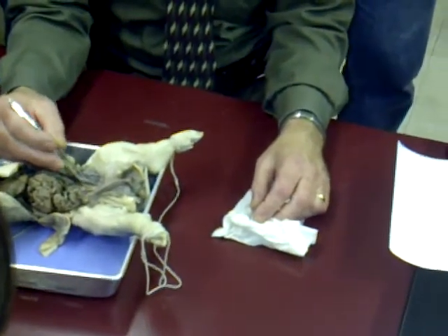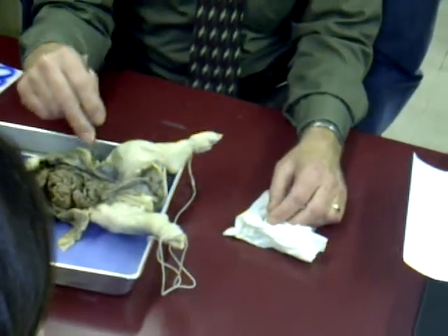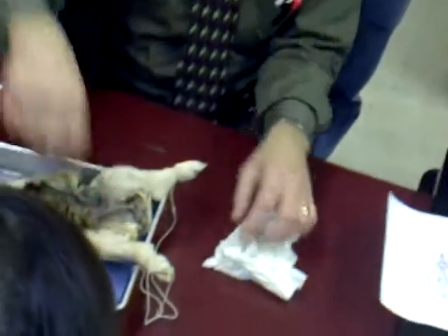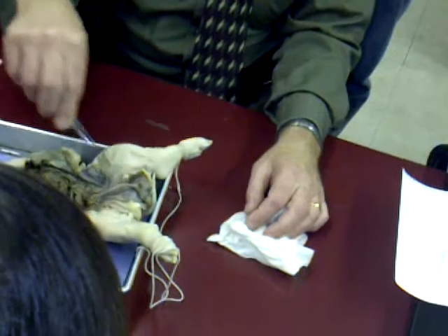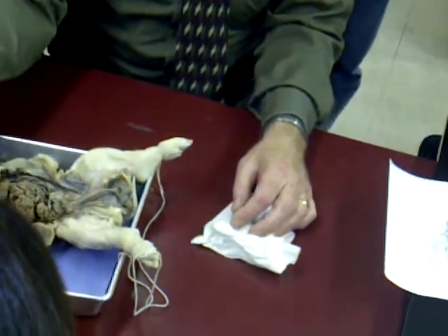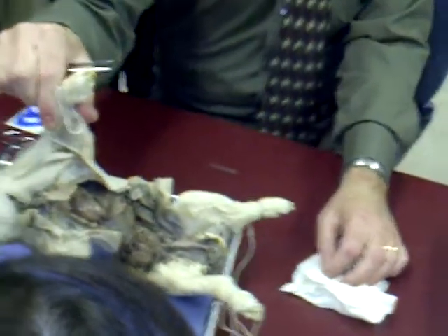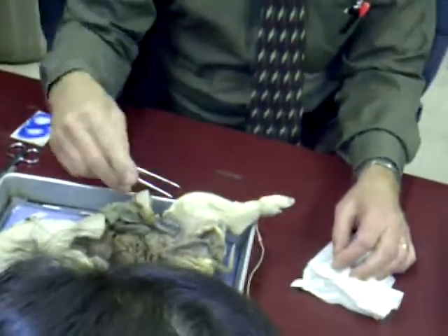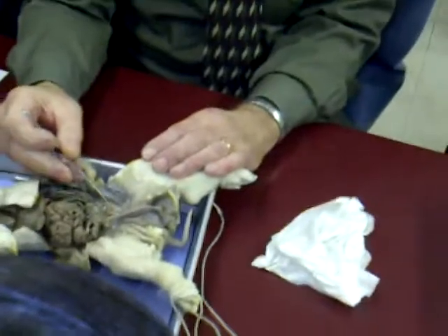Well, remember, that's made for when this pig grows up and has two uteri full of little piggies, and it's walking this way. That broad ligament is going to suspend all of that from the wall of the abdominal cavity. And don't forget, how big are all those little piggies? This big and bigger, each one. Is going to be hanging from one of those, hanging inside one of these uterine horns.